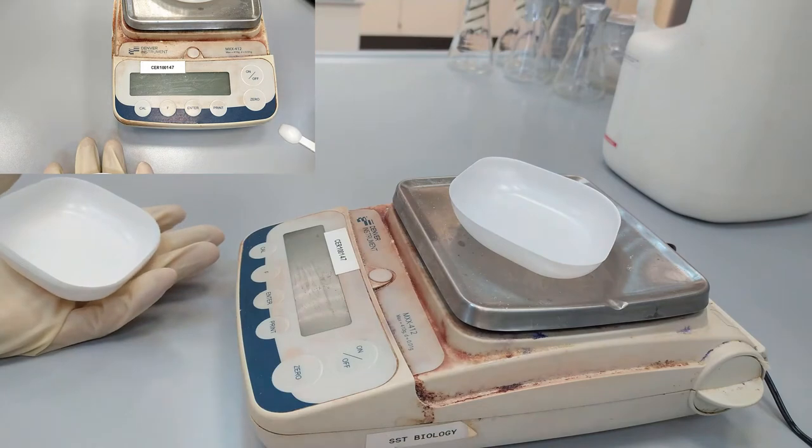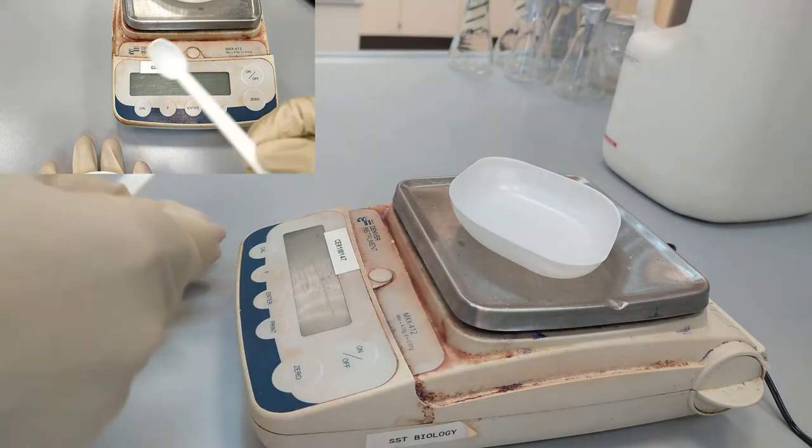For that, we are going to weigh sugar in a special dish with a special spatula.